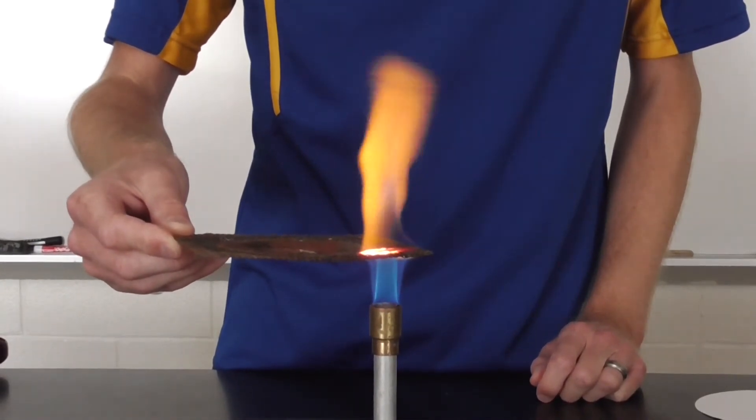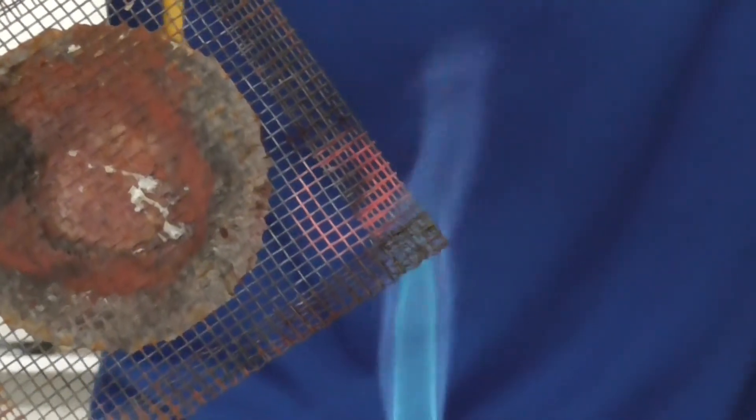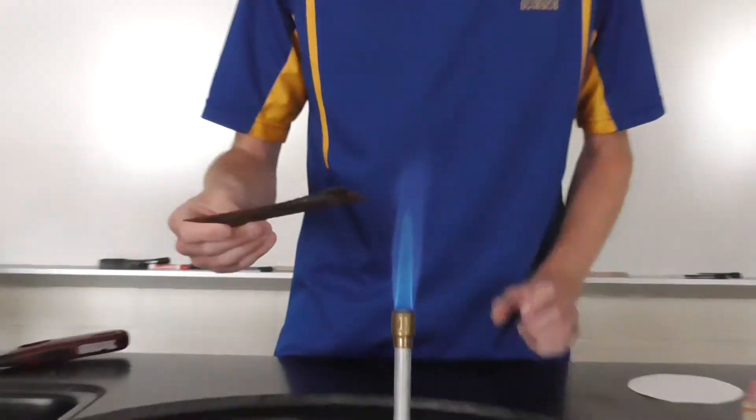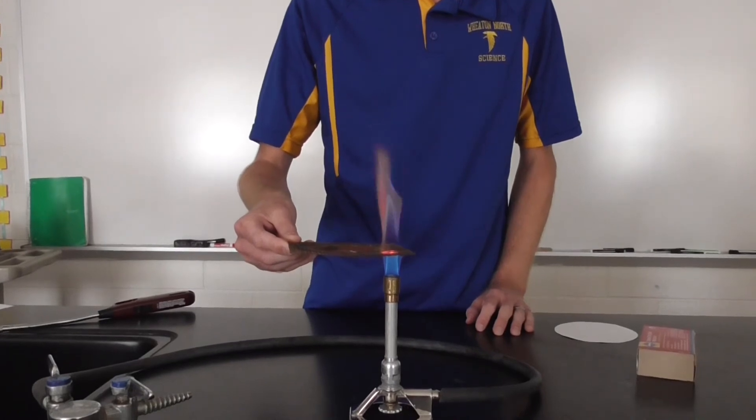If you can see the iron mesh or the wire mesh that's glowing, there's a cold spot in the middle that's dark. That cold spot was produced because the inside of that flame is hollow. So once again, this is not the hottest part.